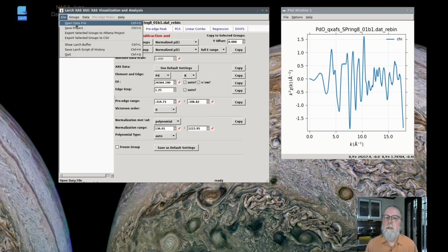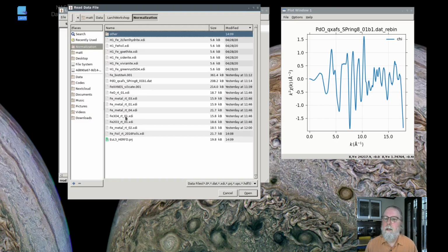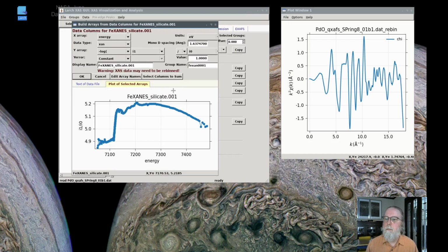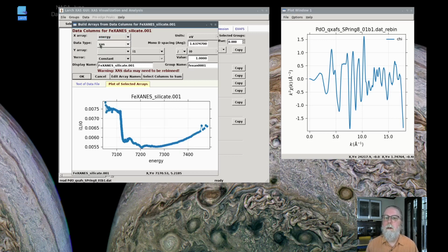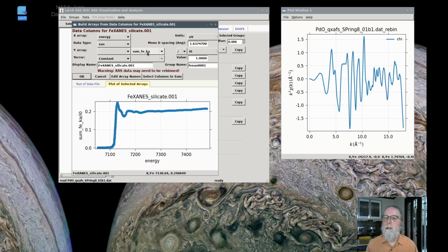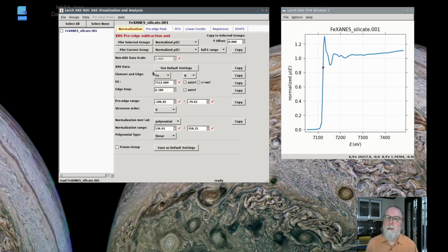over-absorption corrections. So again, for data collected in fluorescence mode, especially with a solid state detector, but even with an ion chamber or any kind of detector, if the element of interest is at too high a concentration, then the data can be suppressed and needs to be corrected. Again, this is fluorescence mode, and it's in units of energy in eV. So I'm going to select the right arrays to read in. That's the iron K alpha sum and dead time corrected for this data set, which has a little bit of dead time, and so that's corrected in that channel.